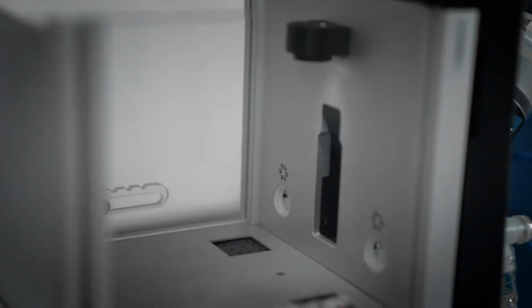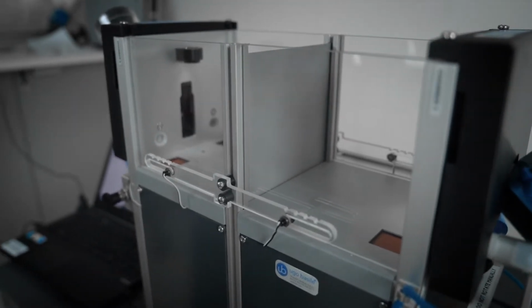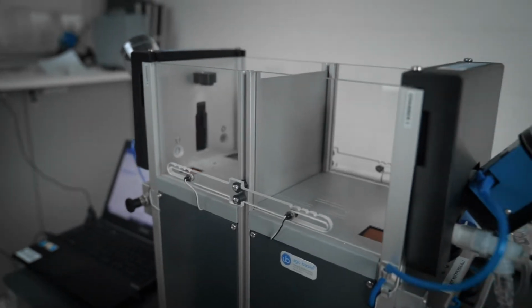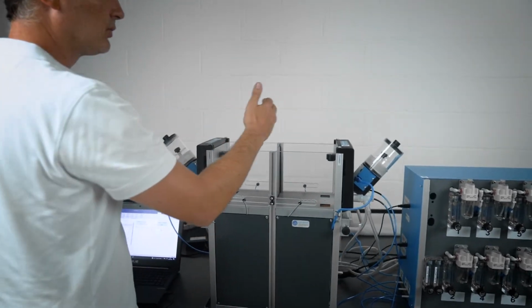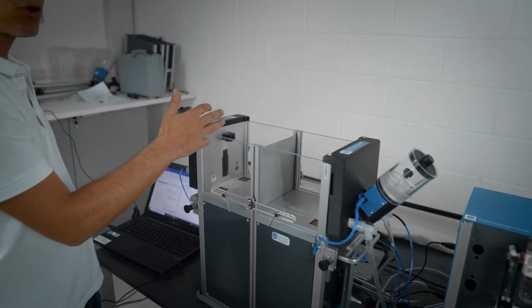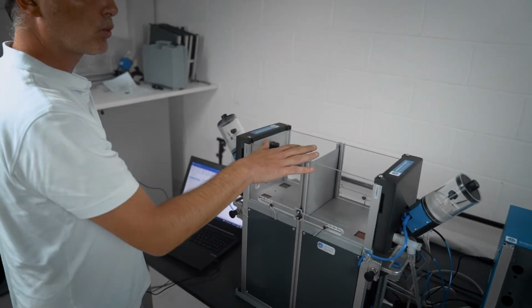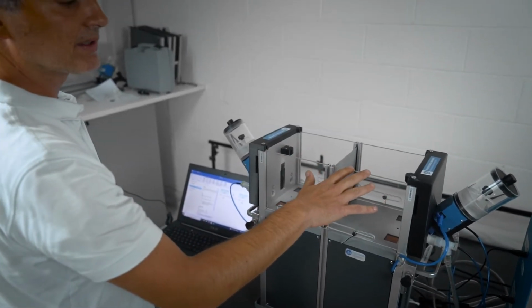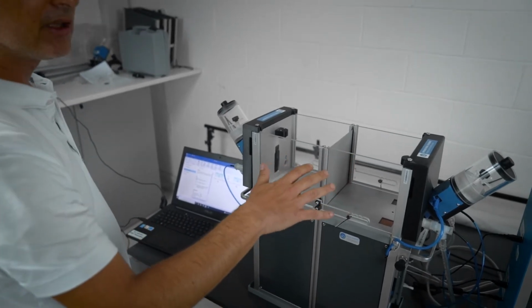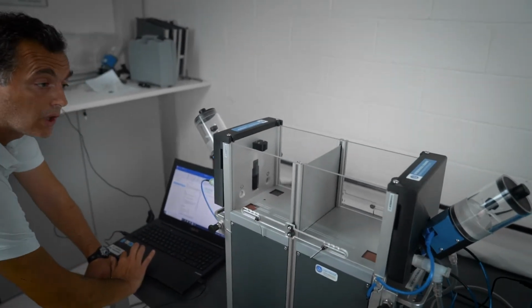I will now operate the door, because the beauty of this system is that you can do a whole series of experiments from simple discrimination to compound discrimination to reversal learning and so forth, with the animal moving from one chamber to the other. So when the animal has completed a trial or a number of trials that you consider the success in a stage, the door will open, and in the meantime, this other side will be already set for the next stage in the procedure that we give for the device. So now I will show you how the door works.